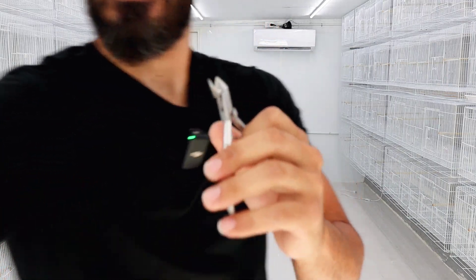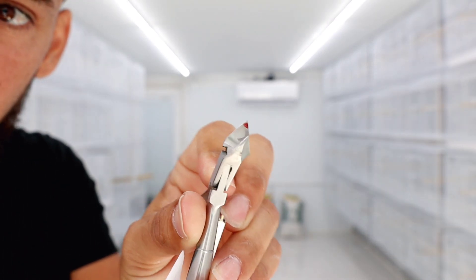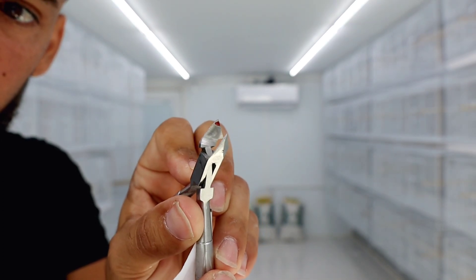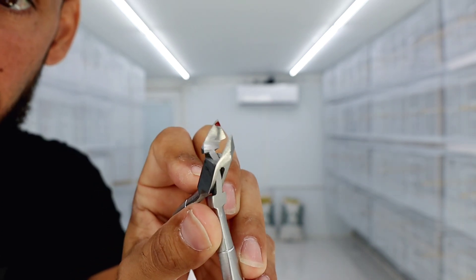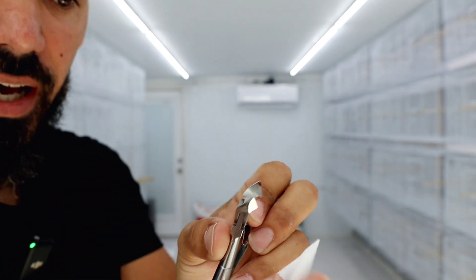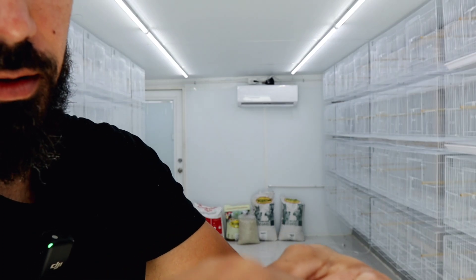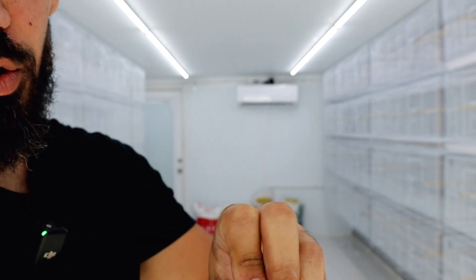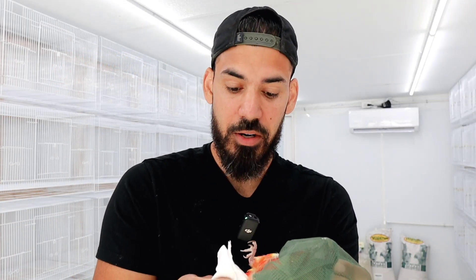This is exactly why you have to clean your pliers or nail clippers before using them on the next bird. You can see that drop of blood right there — that can contaminate your next sample. So after you cut the bird's nail, grab an alcohol pad and clean the tool very thoroughly, because the last thing you want is a little drop of blood contaminating the other sample. This is a little easier when you have help — I'm having a hard time holding the bird in one hand, clipping the nail in the other, and applying the wound care.